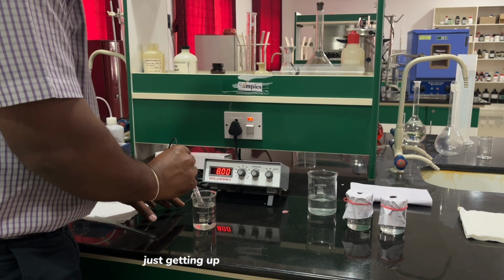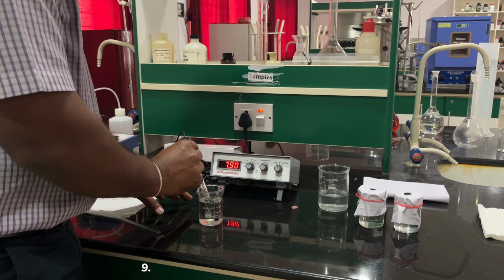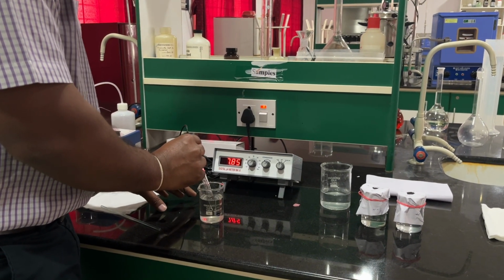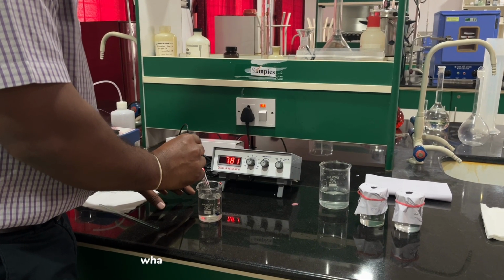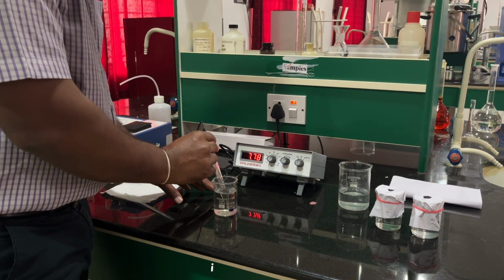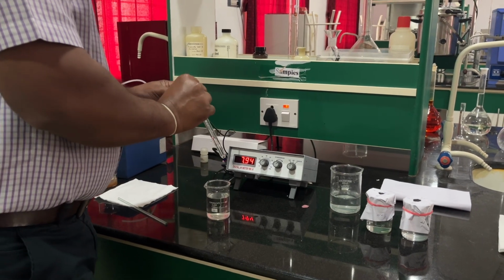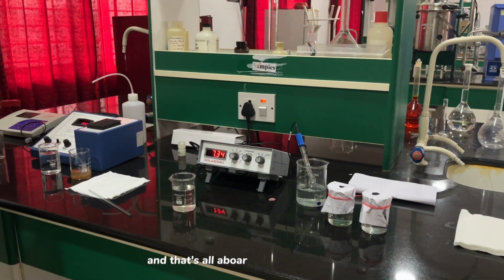It is settling down, and we are getting around 7.8 or so. Whatever reading you get from here, we note it down as the result of pH. So it is around 7.7. Then we wash it again, and that's all about the pH experiment.